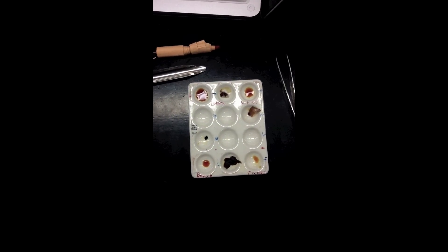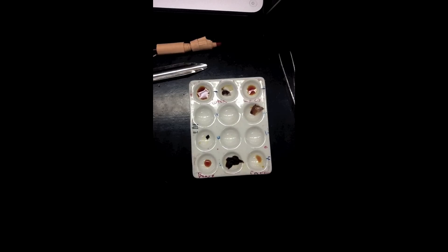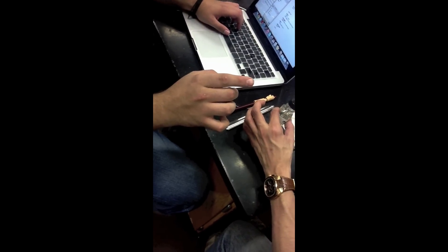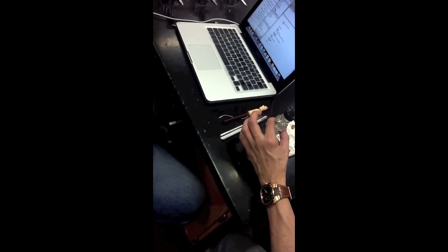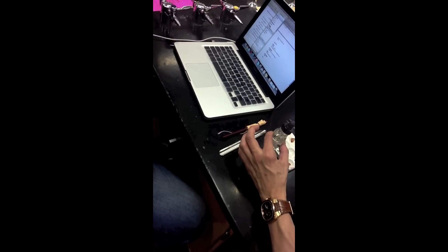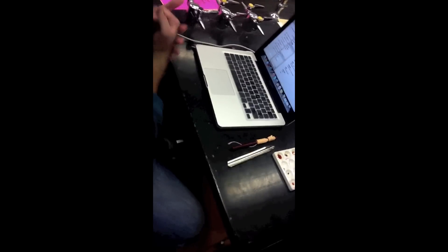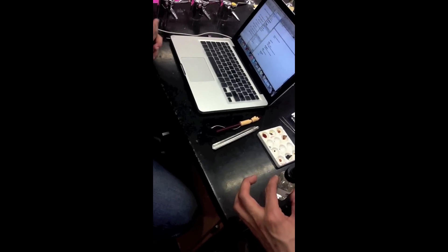This part is just really dark brown. I'm not really sure I'm happy with it. Wait, are we not supposed to — we're not doing the sulfuric acid test right now? Yes we are — for Lugol's I'm saying leave sulfuric acid alone for today. Okay, so we're done with that test. We've finished the Lugol's; it's such an easy test.